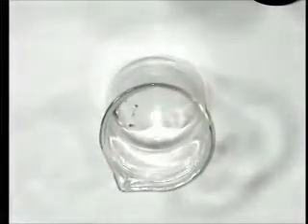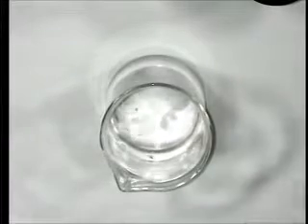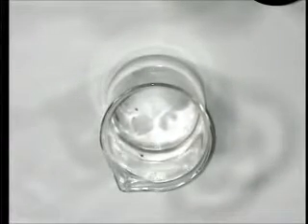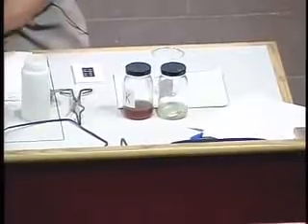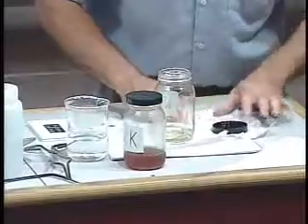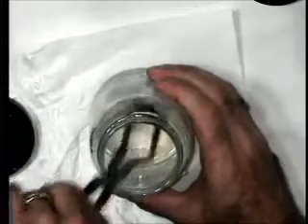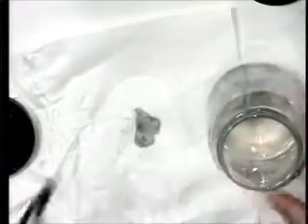You can see in the bottom of this — there's sort of an oily liquid. But over on this side, there is a blob of sodium metal. So what I'm going to do is take a beaker of water. I made the statement that if you react these metals with water, you get an alkaline solution. The oil is just to keep the air and water away from it, for reasons that will become apparent in a moment.